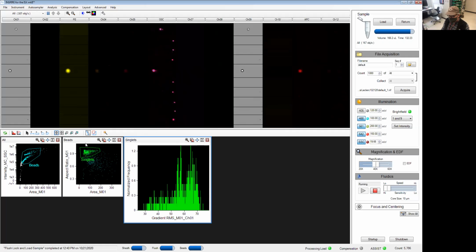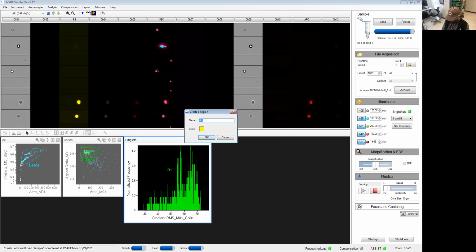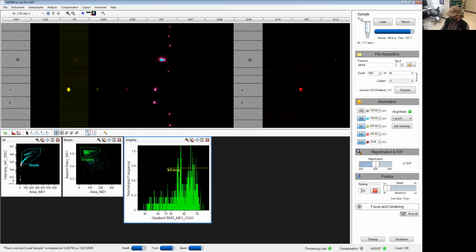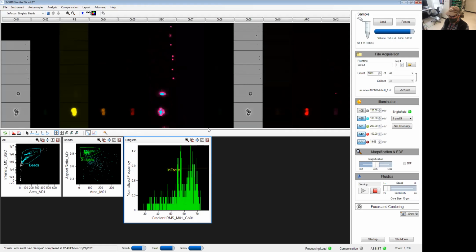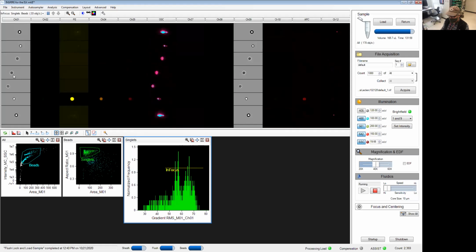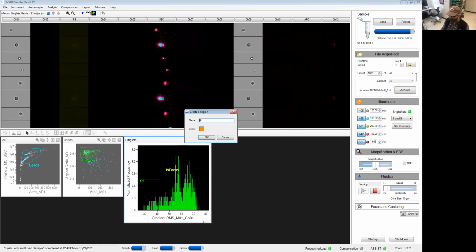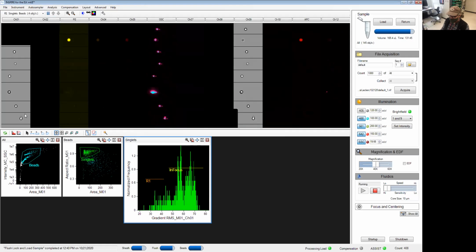So I'm going to make a gate. This is typically for acquisition. I'm going to make a gate that's fairly liberal. I'm going to call this in focus. And anything between 45 and going above is probably good on the 40x. If I show you again, these are fairly in focus events. If I go back and I navigate on the events that are at the lower end of this gradient, then you'll see that these events are all fuzzy looking and not very sharp, not very in focus.